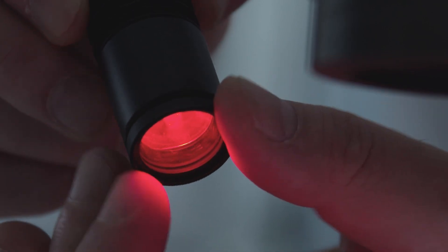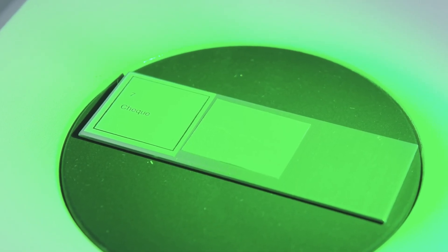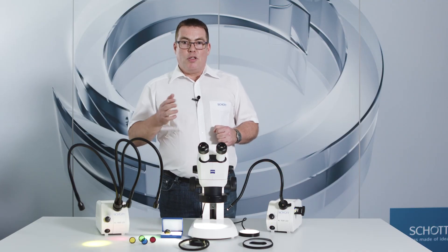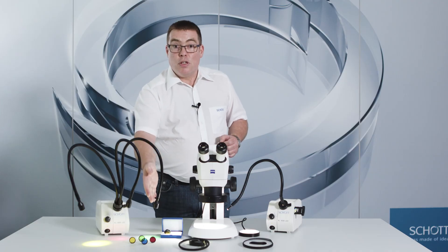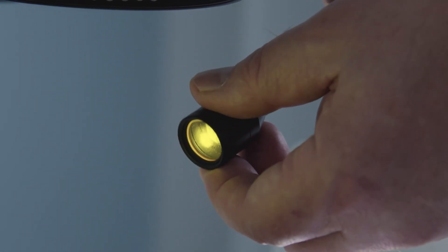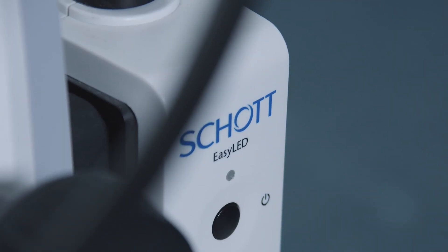For example, color filters can be used to check color printed samples to assess the print quality of packaging. If your cold light source has a filter holder, you can insert suitable color filters directly at the light source. These will then work with all types of fiber optics. Also available are screw-on filters for the focus lenses of our goosenecks and flexible light guides, as well as for our easy LED spots.